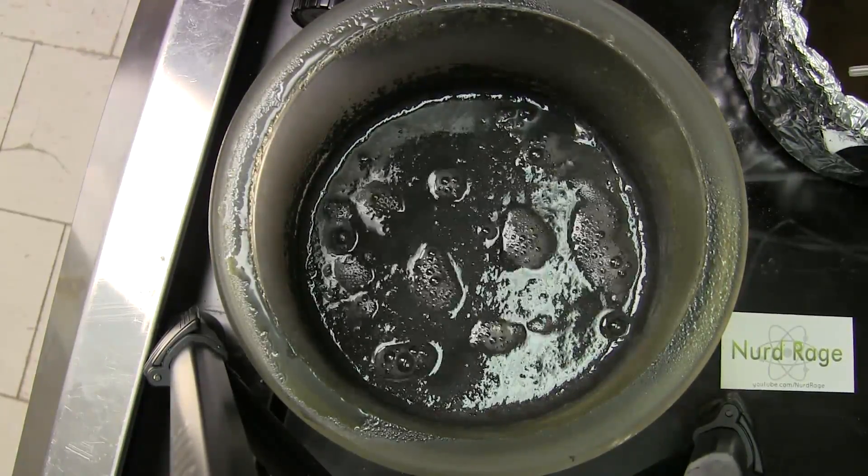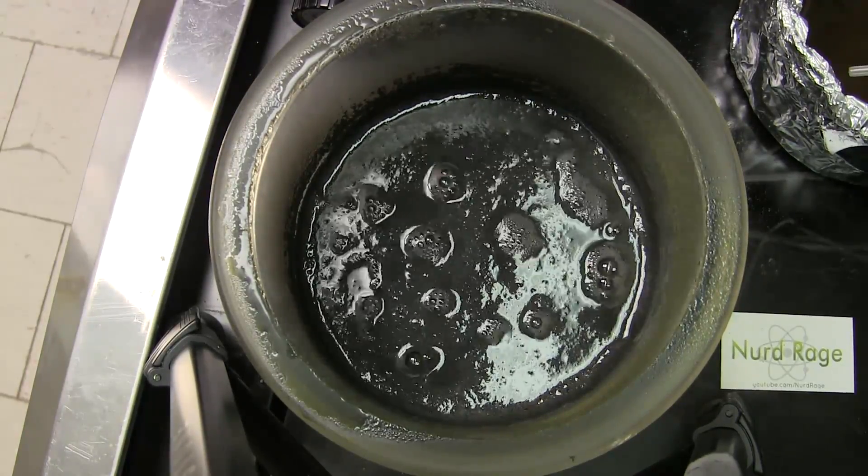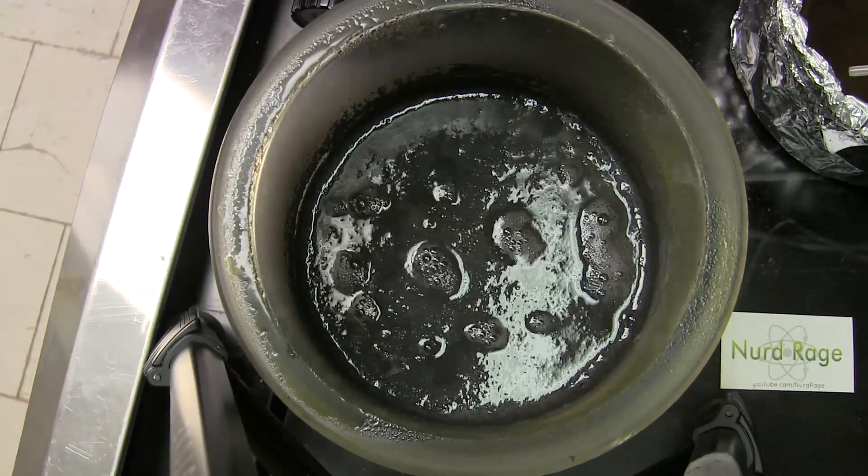The aluminum platter itself and the case are worth more. Nonetheless, it is impressive that we can create a coating so perfect as to seal an aluminum platter against acid using just a few cents worth of extra metals.